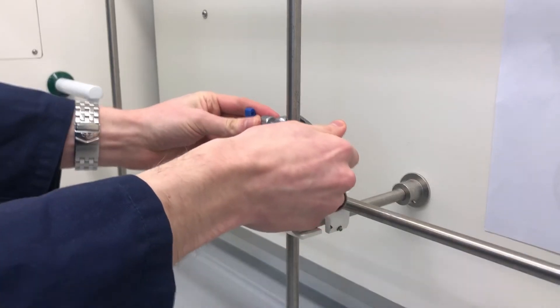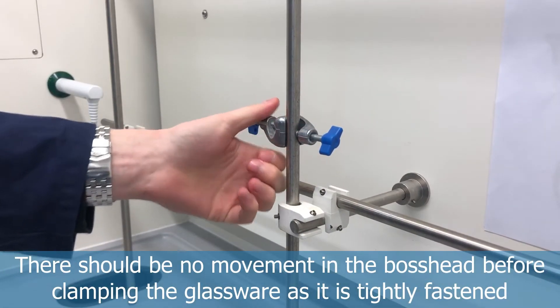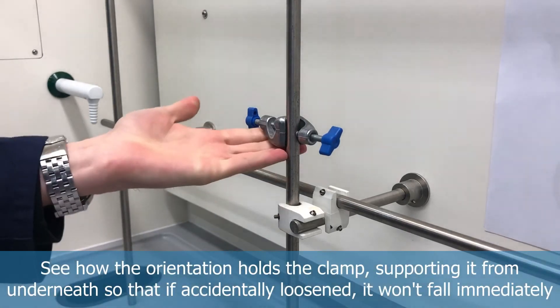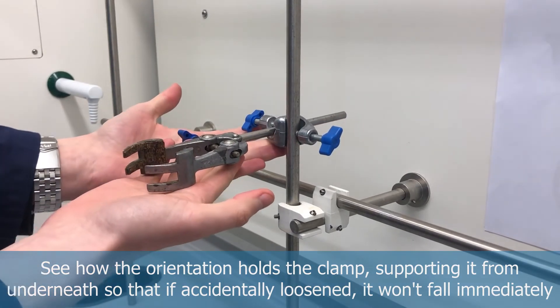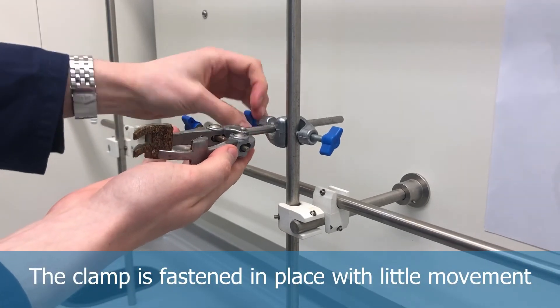You can also see that the groove accommodating the clamp is oriented so that it supports the clamp from underneath. Make sure it's nice and tight before proceeding — give it a little wiggle to check there's no movement, so the apparatus won't fall after clamping. Confirm once more that the groove supports the clamp from underneath and that it's clamped tight with no movement.